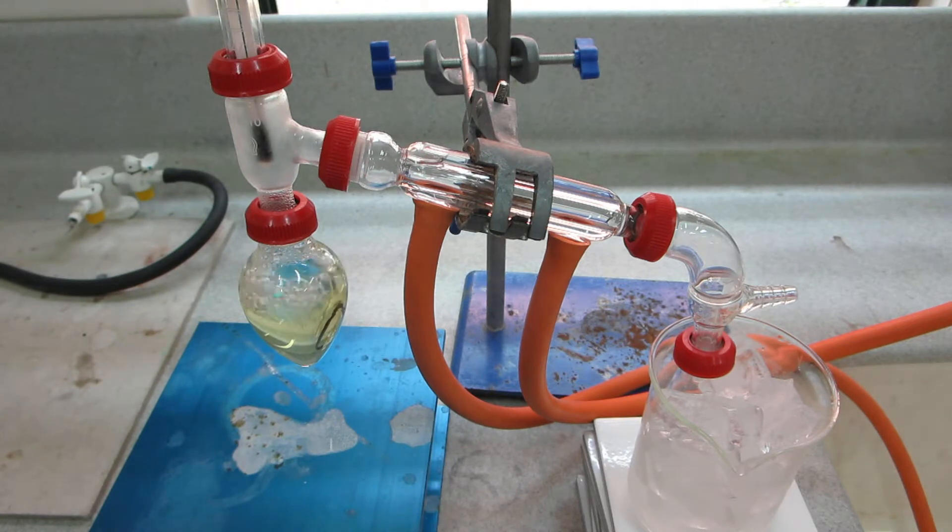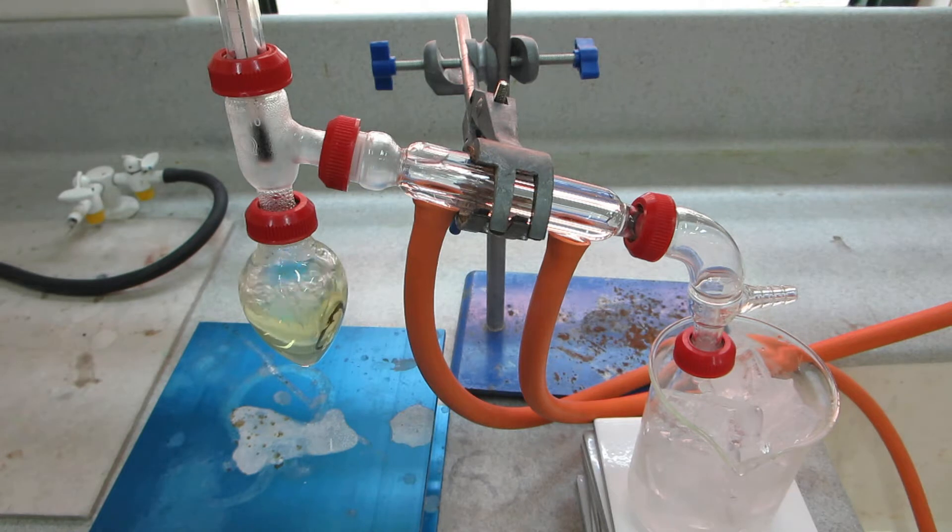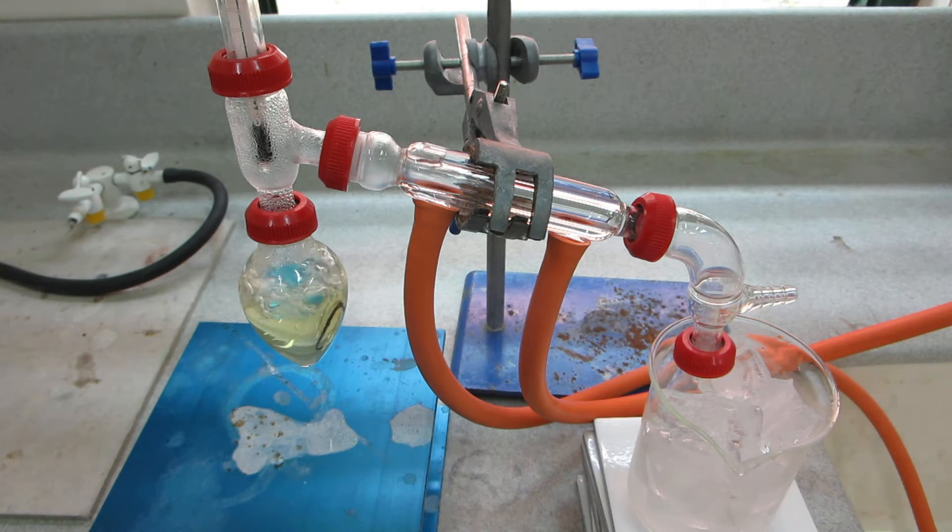So we've got quite a vigorous reaction now. The thermometer reading is shooting up. It's 40 very rapidly. 50, 60, still rising.